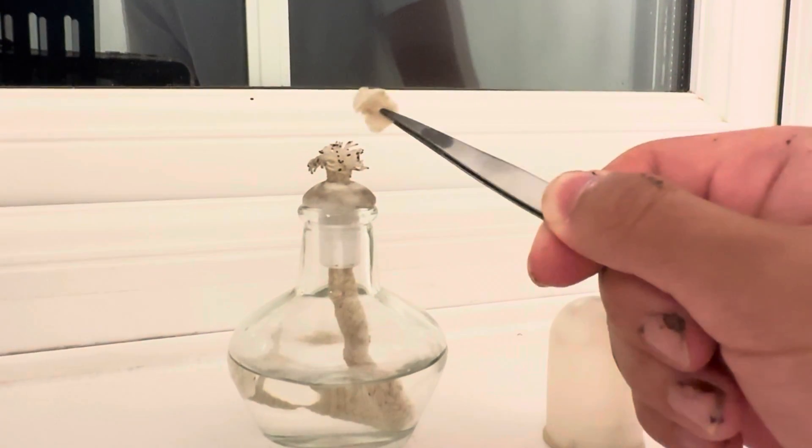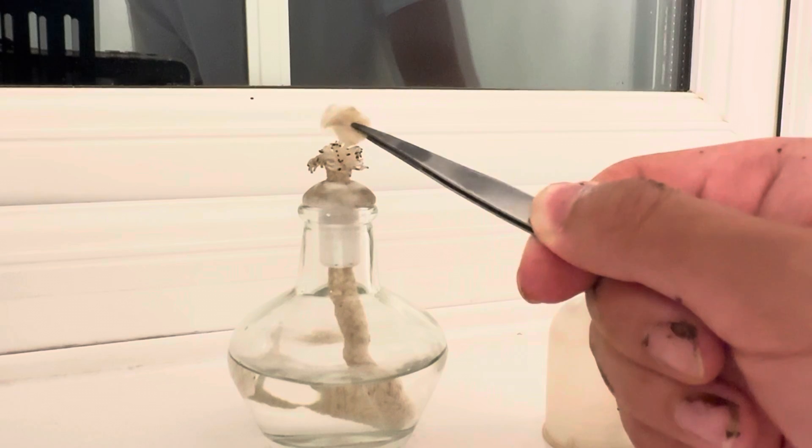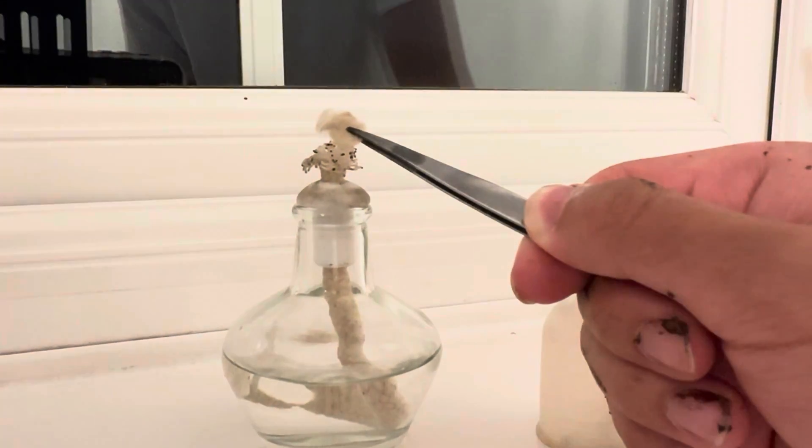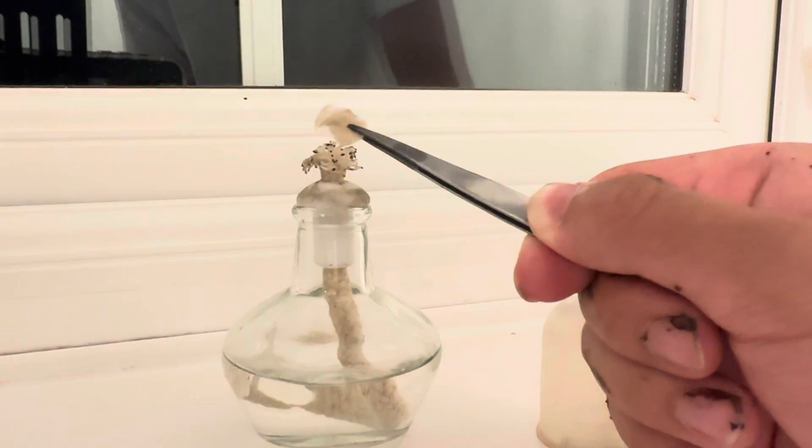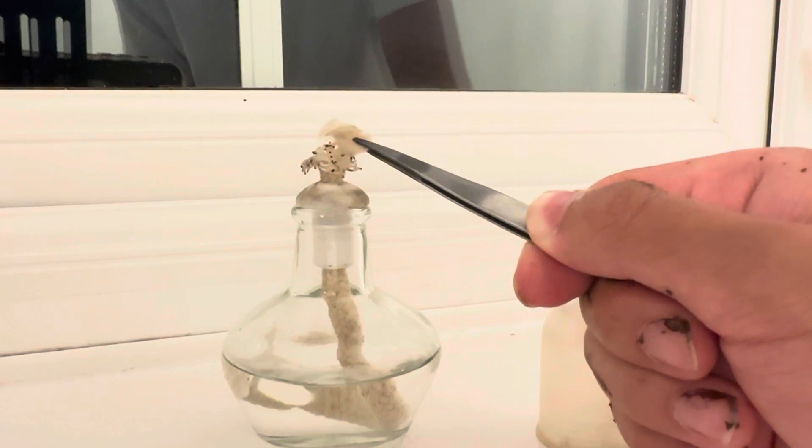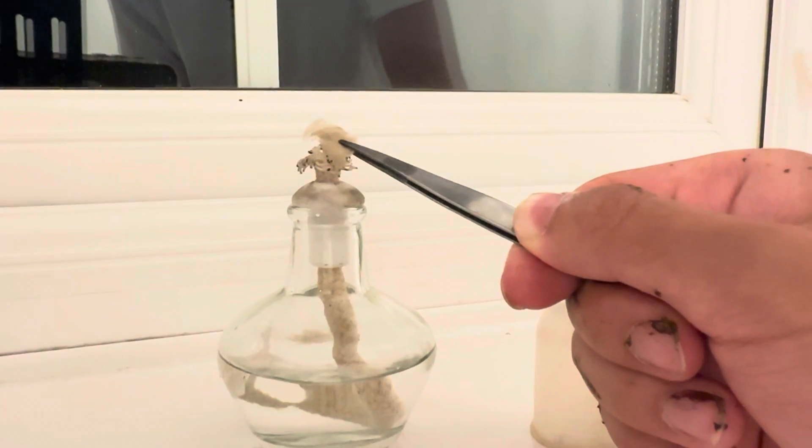So, put the wool lightly onto the wick for an extended period of time. The wool may simply start to heat up and ignite the alcohol mixture. In our case, it may take a little while.